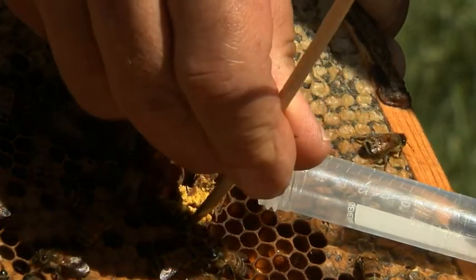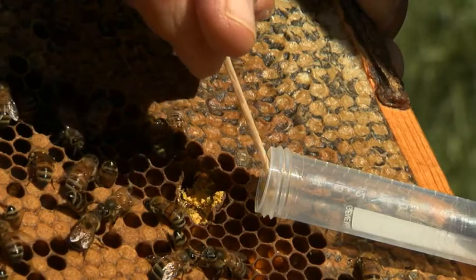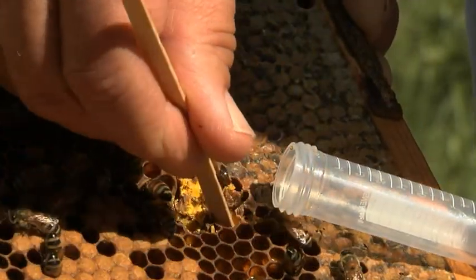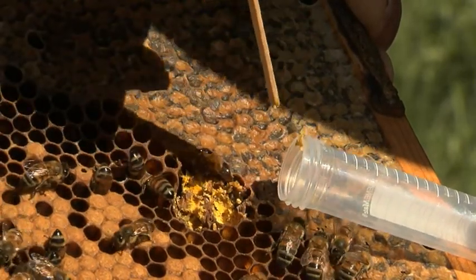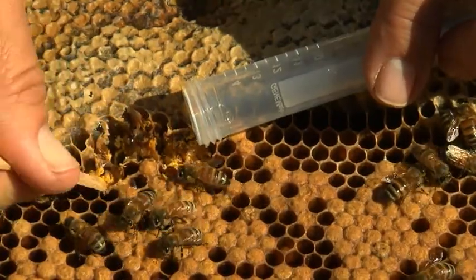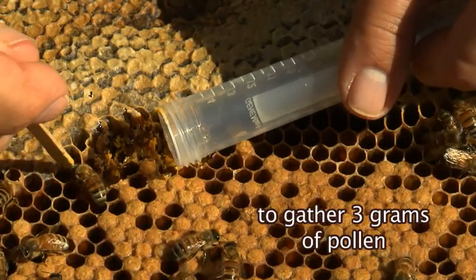As you lift the stick from the cell, move slowly as the dry pollen is crumbly and may fall off the stick. Place the pollen in the plastic container by scraping the stick on the side of its opening. Make sure that the pollen falls into the container. Repeat in at least 4 cells per hive to gather the 3 grams of pollen needed.